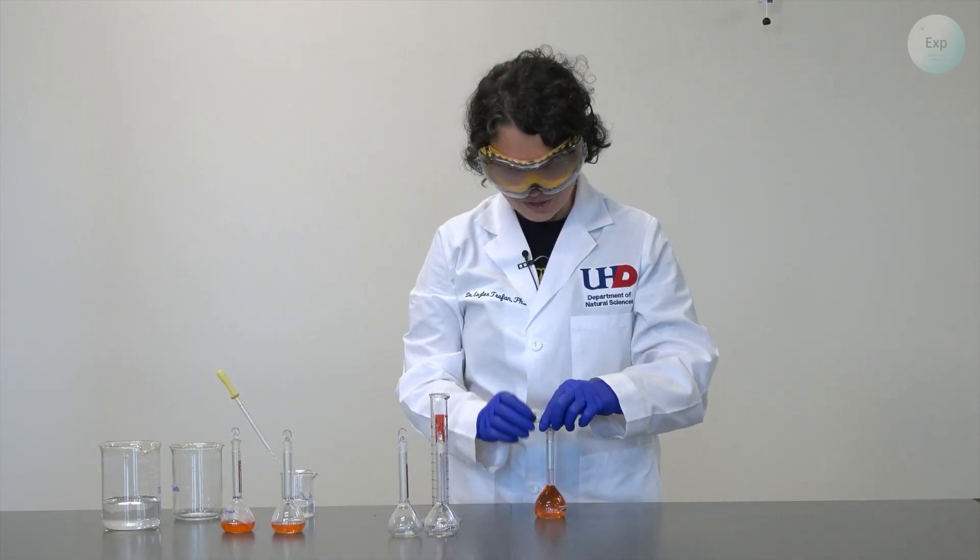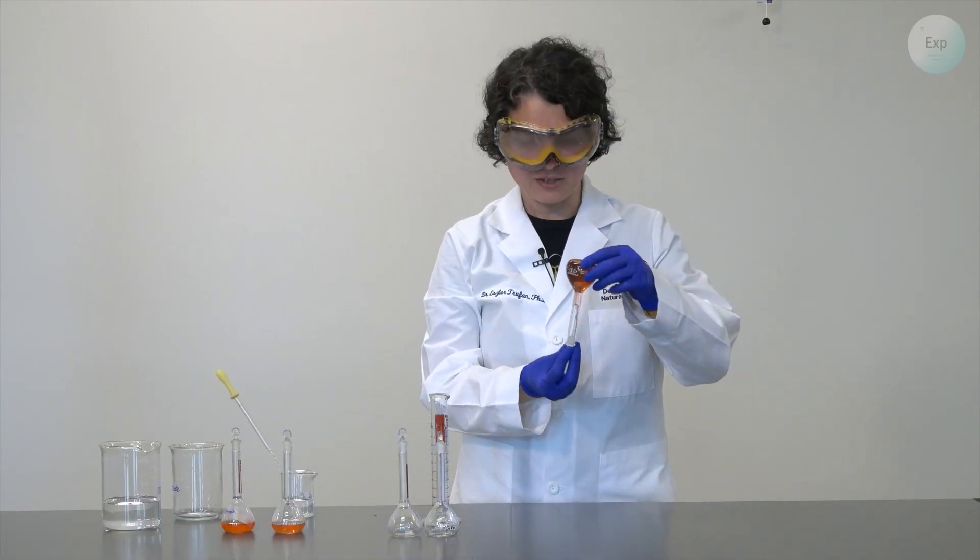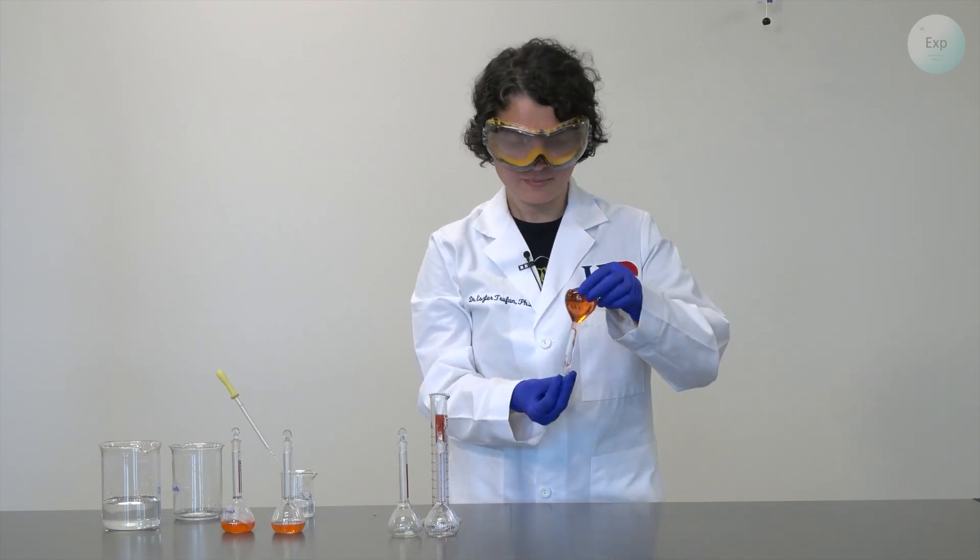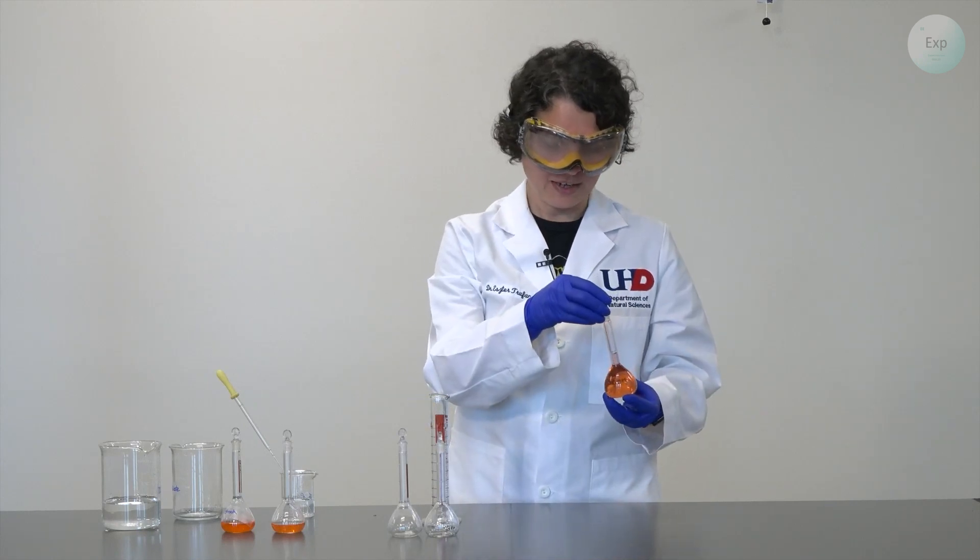The meniscus of our solution is at exactly 50 milliliters. We homogenize it, and we're ready to move on to the next step.